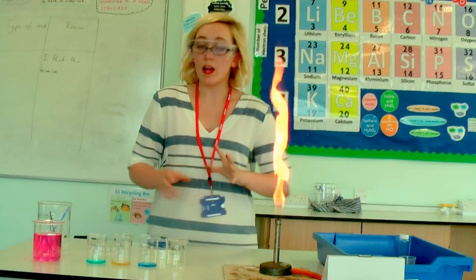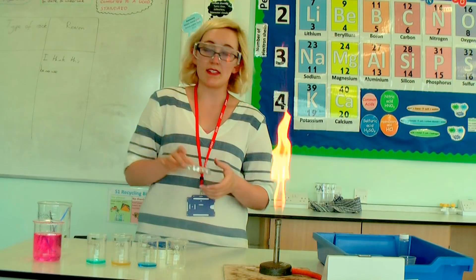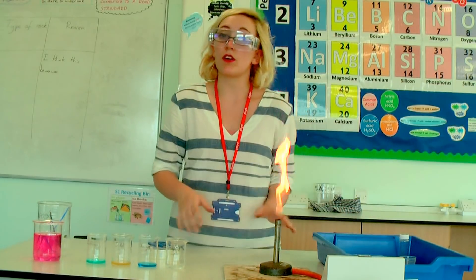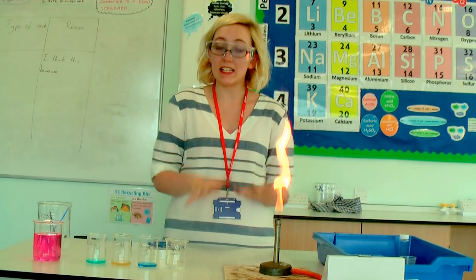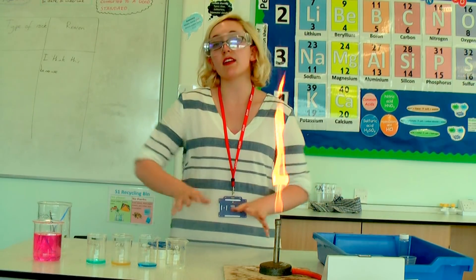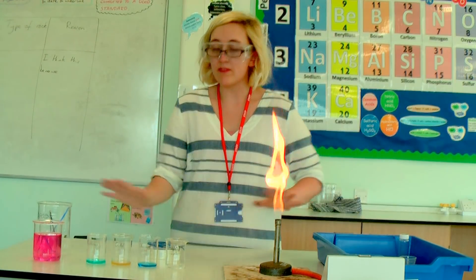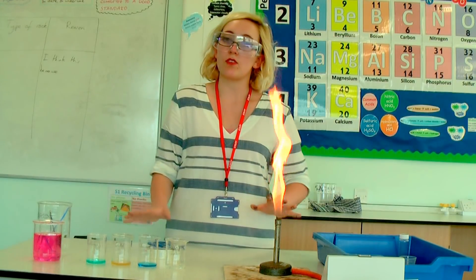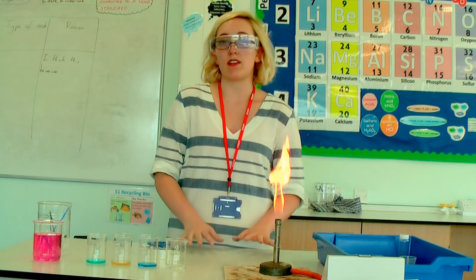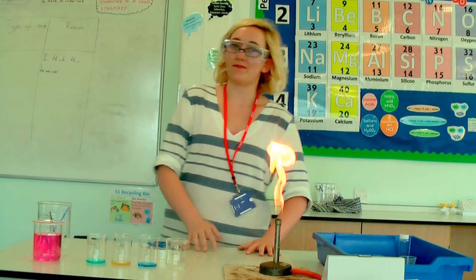Now that I'm done with my experiment, I'm going to put this in an incubator and clear my work surface. I will wash my hands thoroughly and wash everything else I've used with disinfectant. Thank you very much for watching.